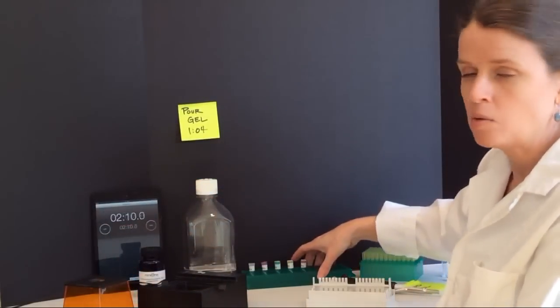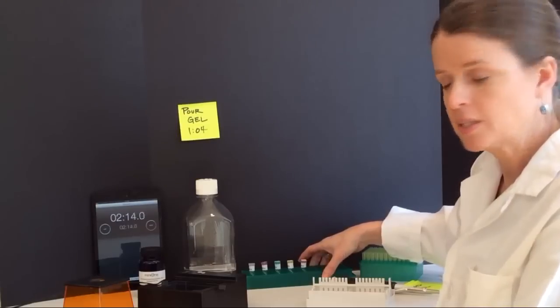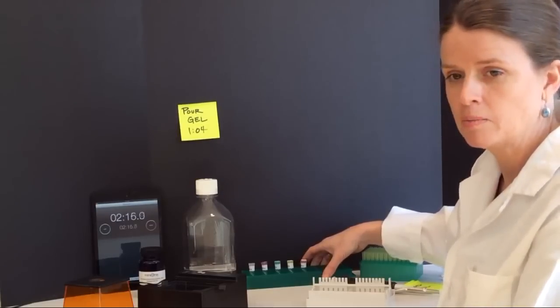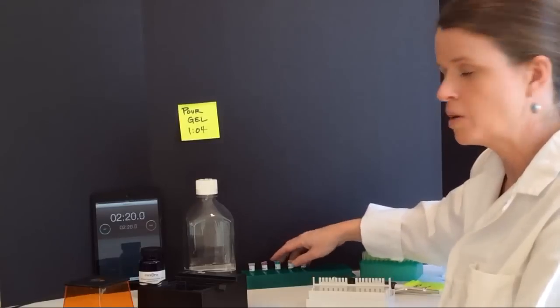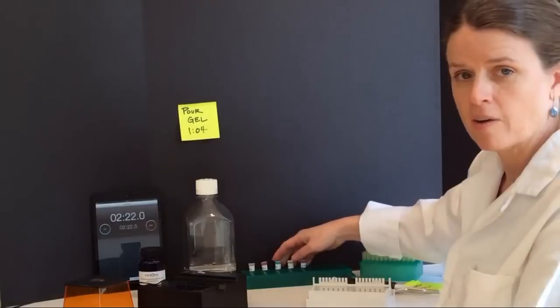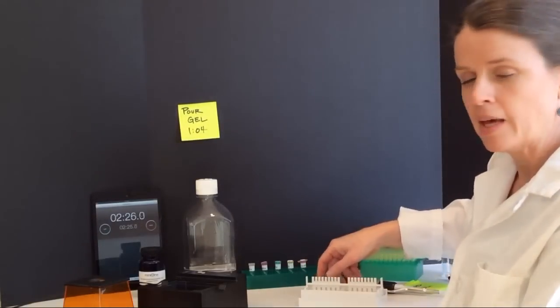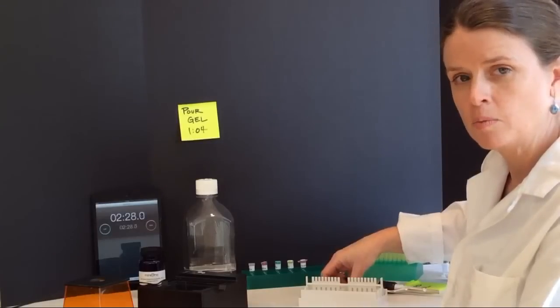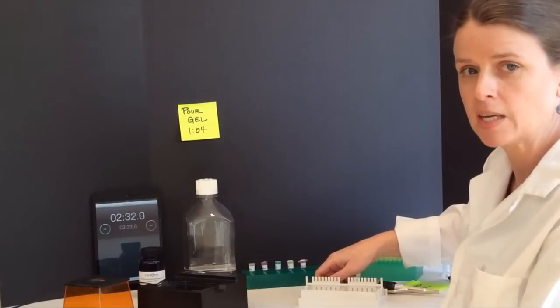Today's lab will be running a Mini One kit called the DNA Fingerprinting Kit. In this fingerprinting kit, we're going to be helping Luna, a calf whale, determine which of the three possible males could be her father. I'm going to let my gel solidify for a few more minutes. This process should take us only between 5 and 10 minutes.